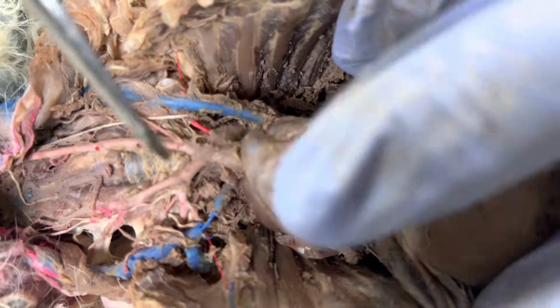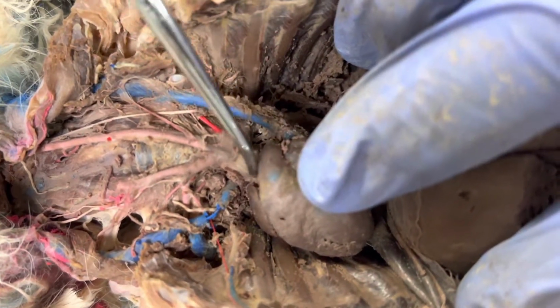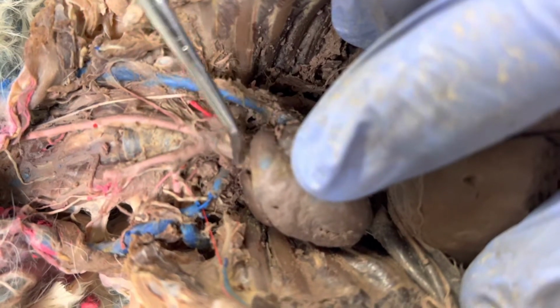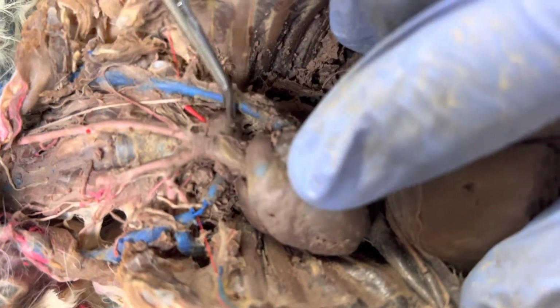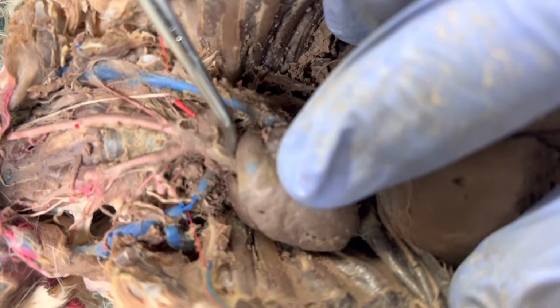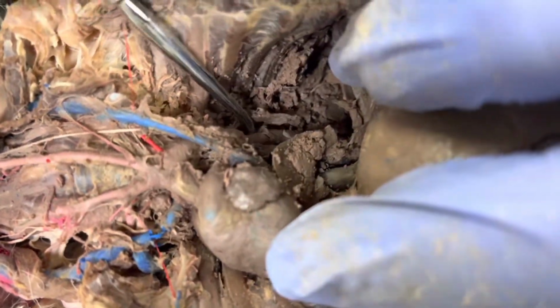All right, so we're going to be looking at the arteries in the rabbit, and we're going to start on here again on the aortic arch. We actually did a video on this last week, but we're going to just review it real fast. So there's our aortic arch right there. That's the ascending aorta. There's actually the arch right there, and then I'm going to have the descending aorta, which is going to go down into here, and we'll get to that in just a minute.